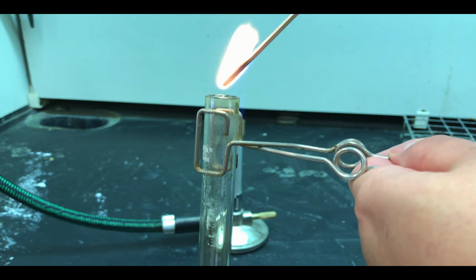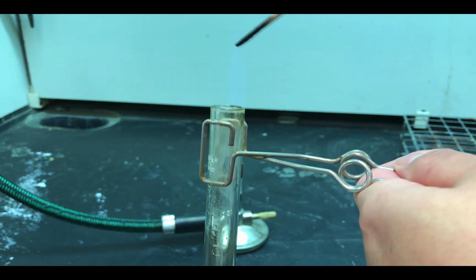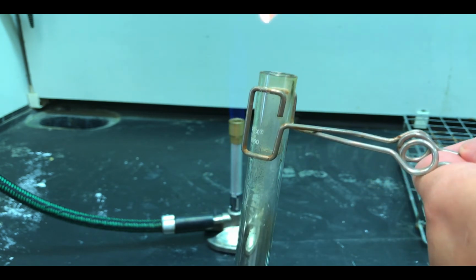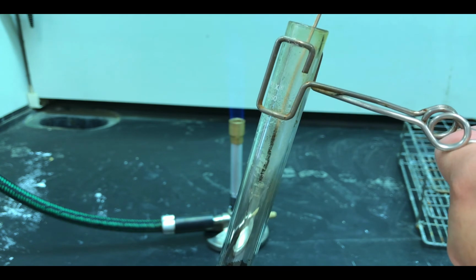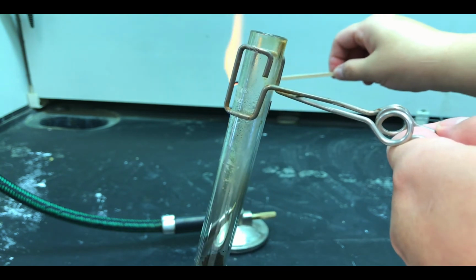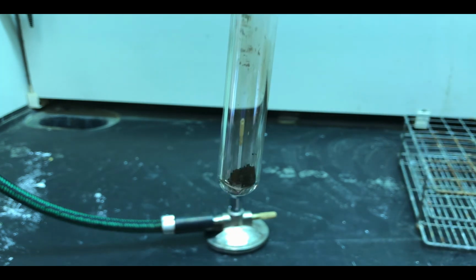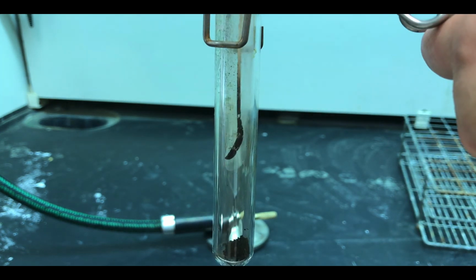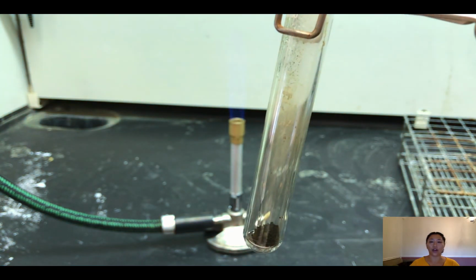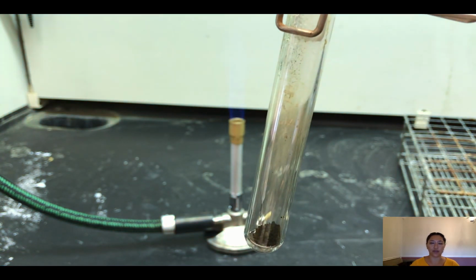So, let's try one more time. It happened again. I wonder if that is the observation. 3rd time for good measure. Clearly, that is the observation. Jot it down. And those are your observations for the Chapter 7 Types of Chemical Reactions lab.